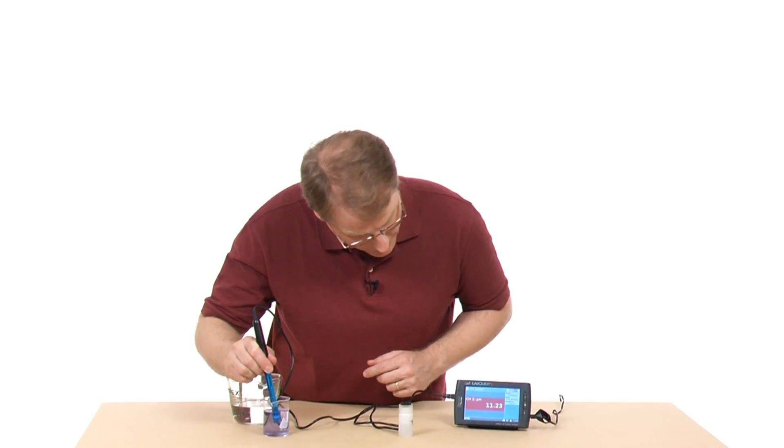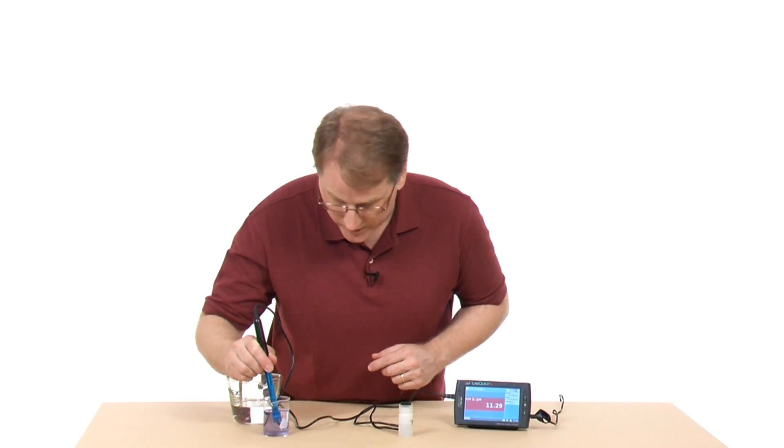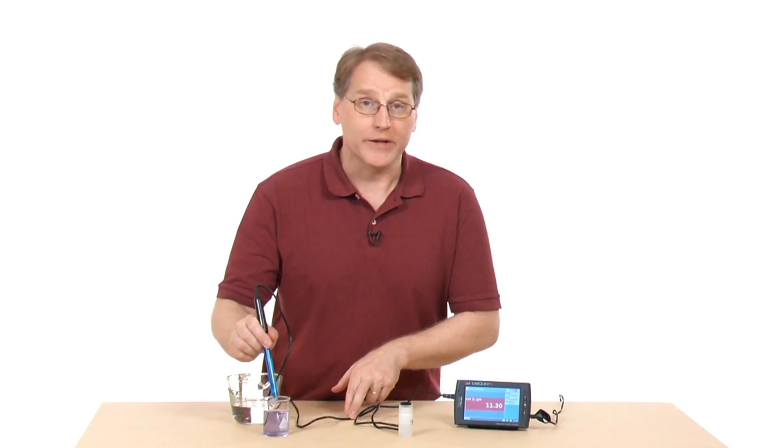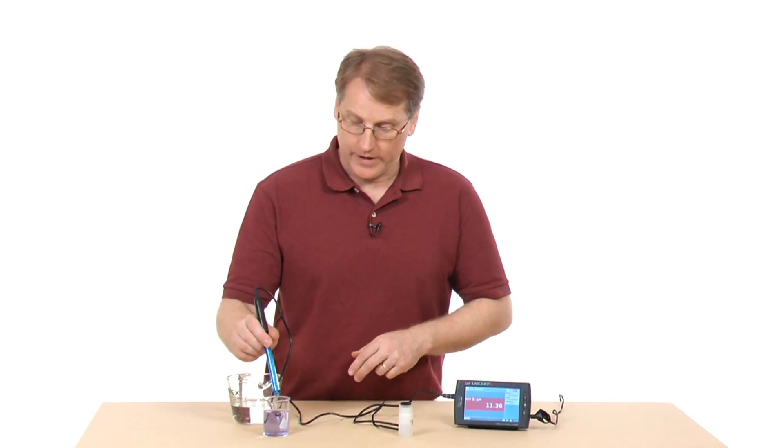It's stabilized at about 11.2, so it's obviously a base.